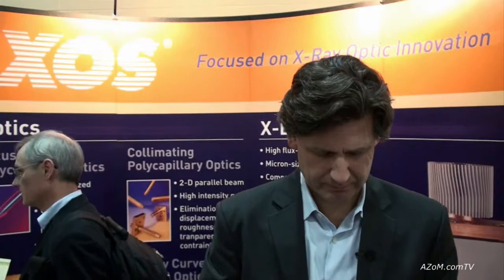This is Cameron Chai from azom.com and I'm speaking to Barry Bumer, who's the Vice President of Marketing and Sales at X-Ray Optical Systems, and he's going to demonstrate and show us what it is that they make.